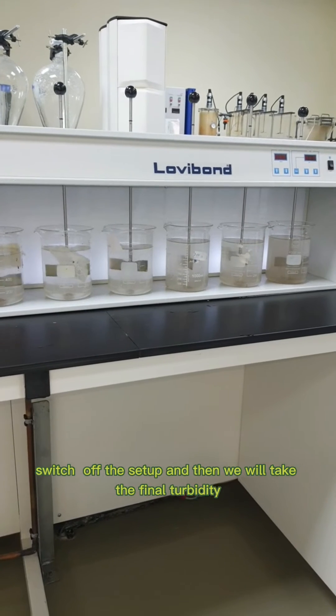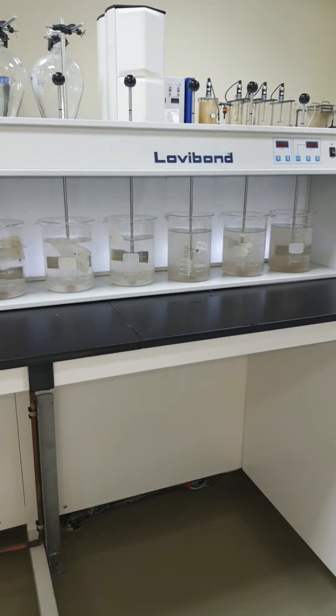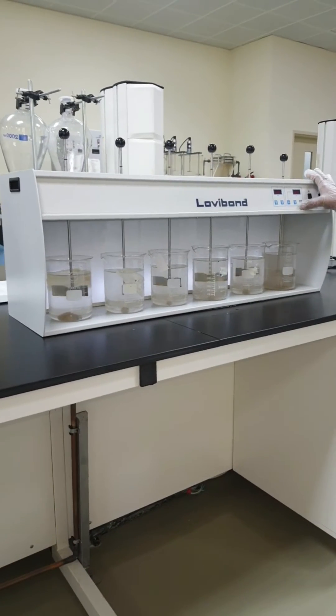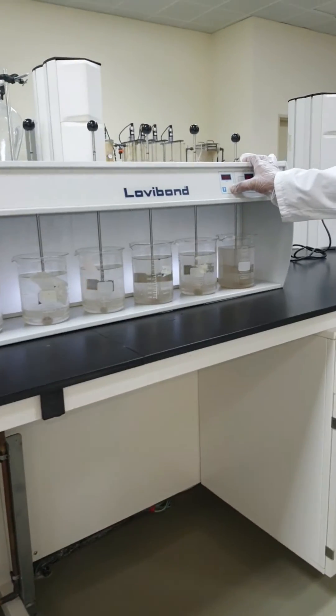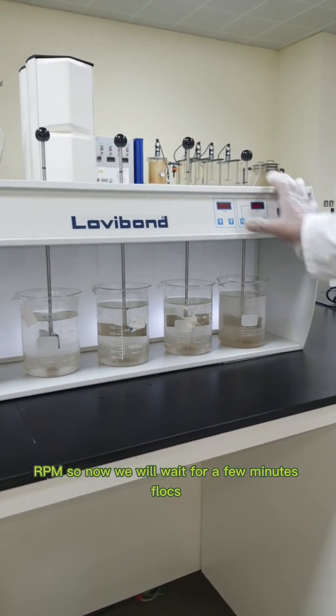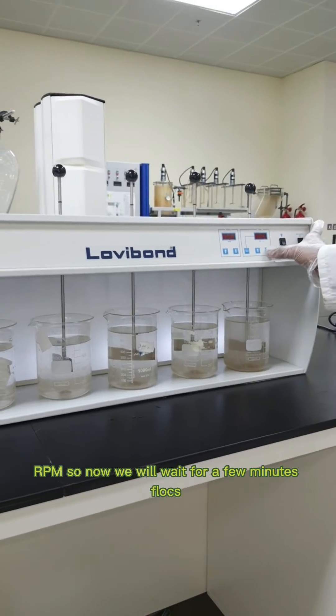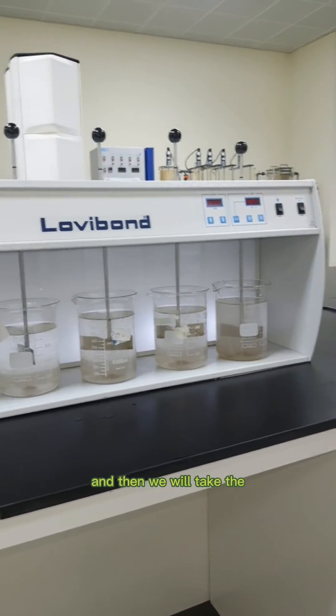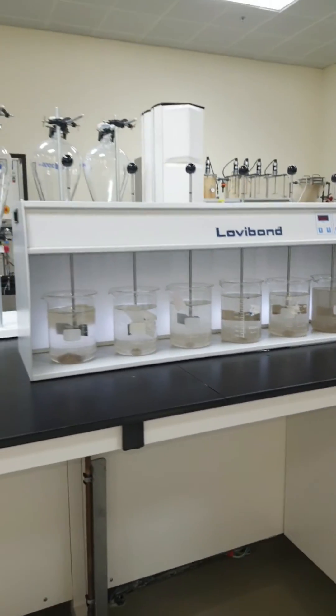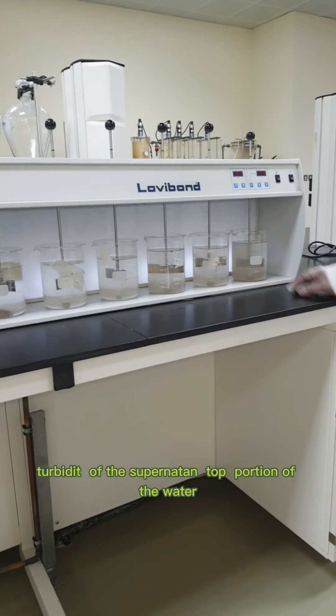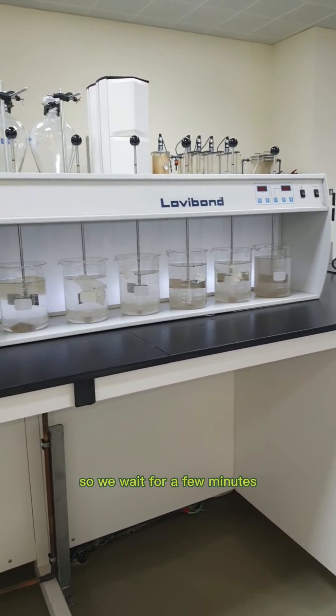Now we will stop the RPM. We will wait for a few minutes for the flocs to settle down, and then we will take the turbidity of the supernatant, the top portion of the water.